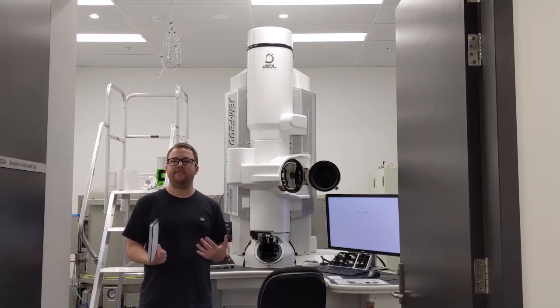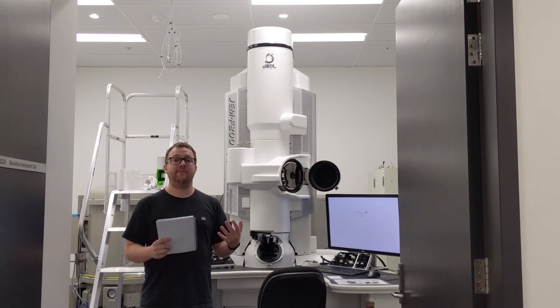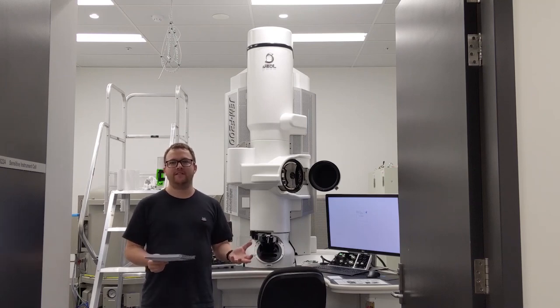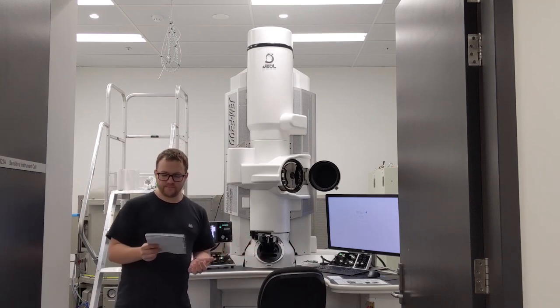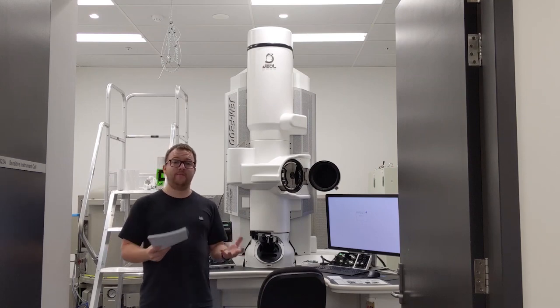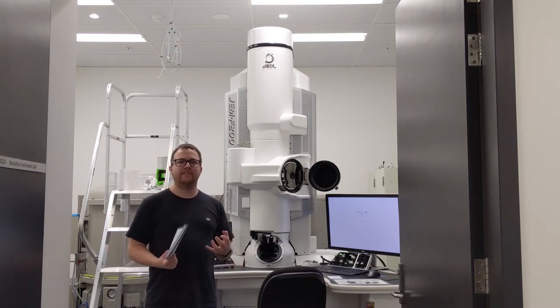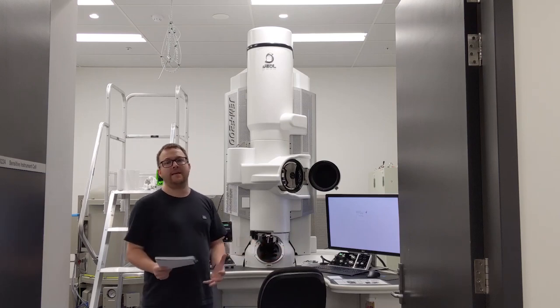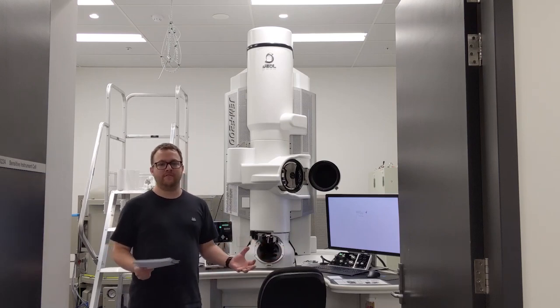And if we compare that to visible light, which is about 500 nanometers, it's about 100,000 times smaller than that. This small wavelength allows us to see much smaller things with the electron microscope than we can with a visible light microscope.